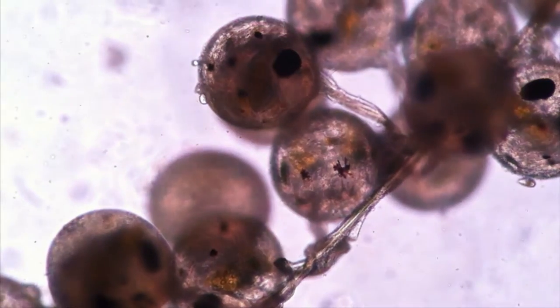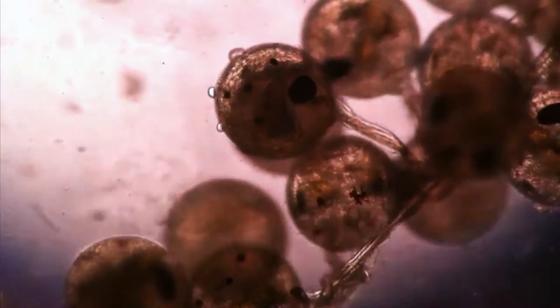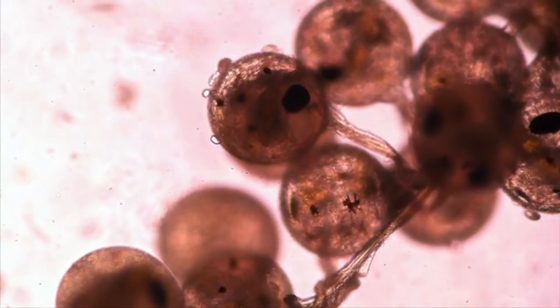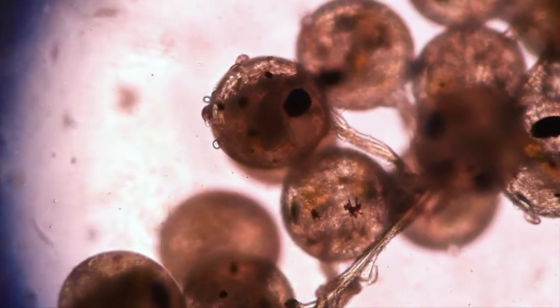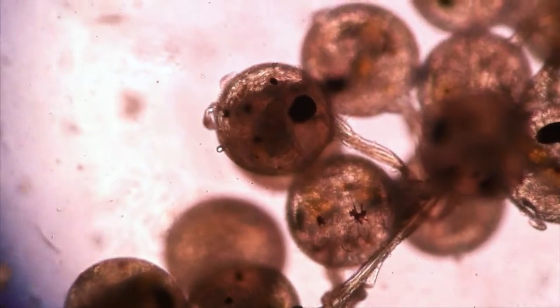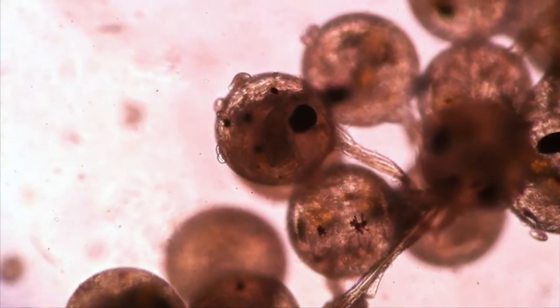Here I'm looking at a cluster of crab eggs. I was actually looking for a certain type of worm that parasitizes these eggs, but I was not able to find it. But I did see these little guys crawling around on the eggs — these are little ciliates.